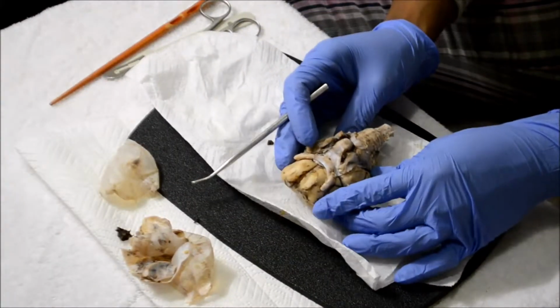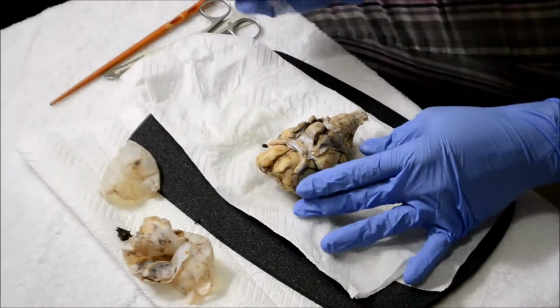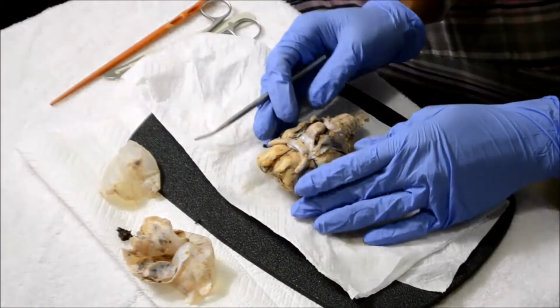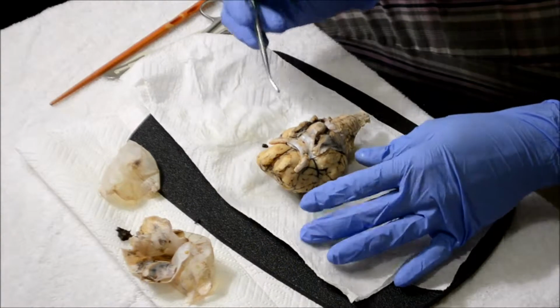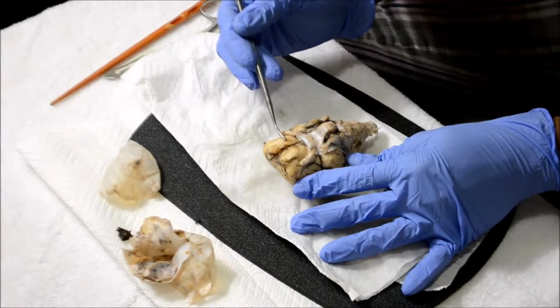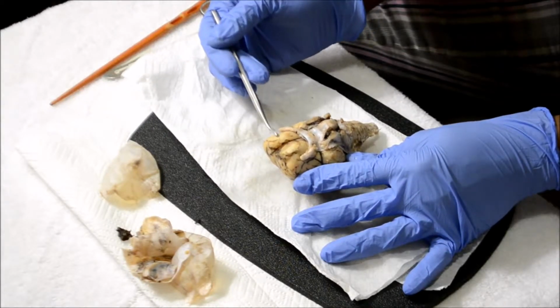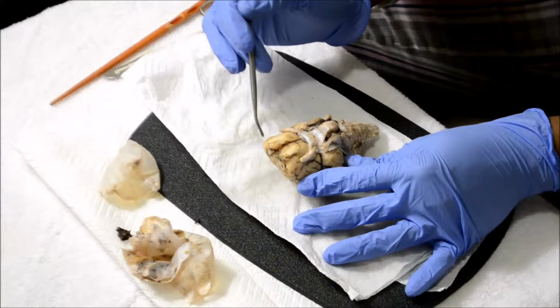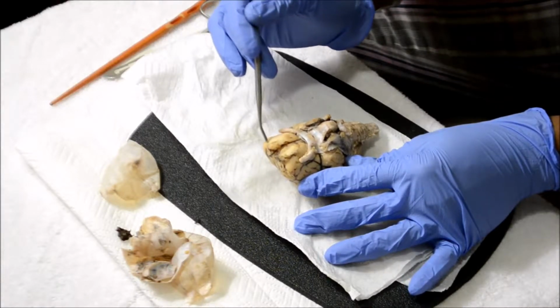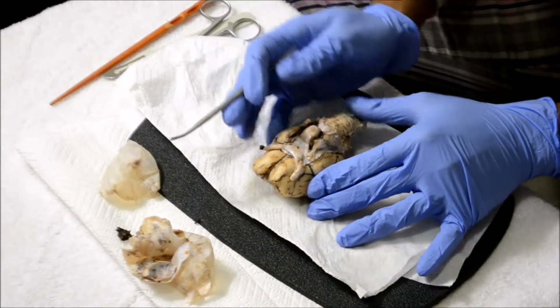Next, we will be looking at the inferior view, which is upside down right here, and we'll be looking at cranial nerves 1 through 6. The first is the olfactory nerve, which is this right here. You can barely see it, but that's the olfactory nerve. And then the olfactory bulb is the tip right there, while the olfactory tract is this right there, leading.